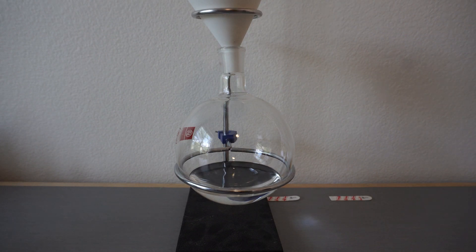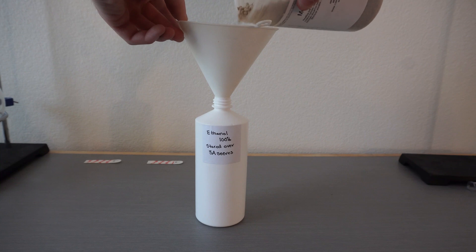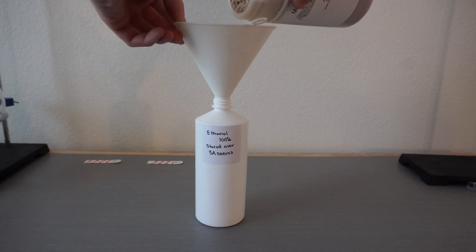So even today I used the drying agent of molecular sieves to create my 100% ethanol. Next time I really want to try the toluene method and boil it off azeotropically. But until then, have a great rest of your day!